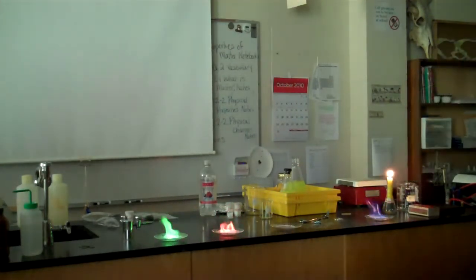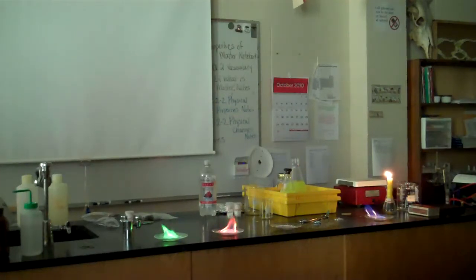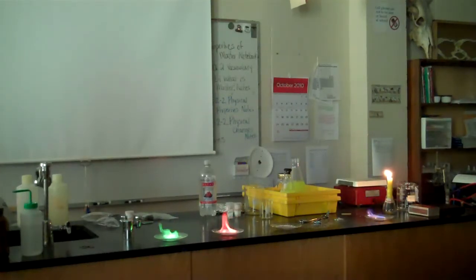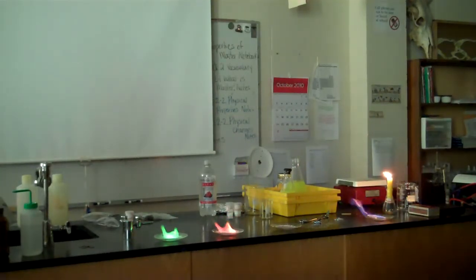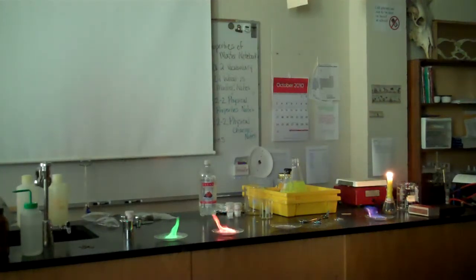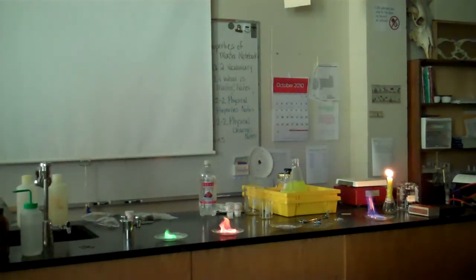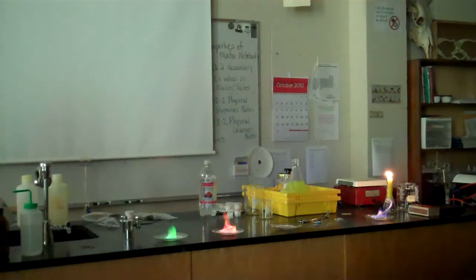The one in the middle ran out. Why did it go out? Because it didn't have any more fuel — it ran out of fuel. So the fuel in this case is the methanol.